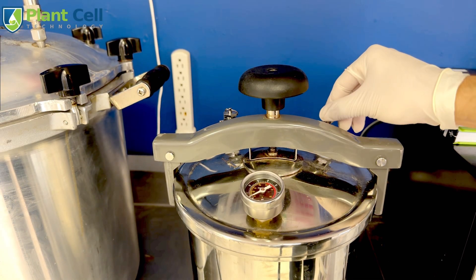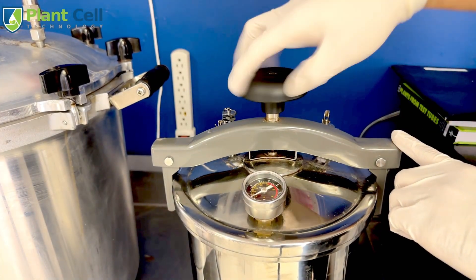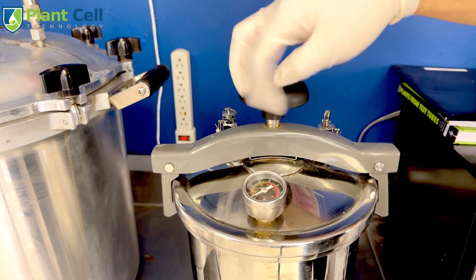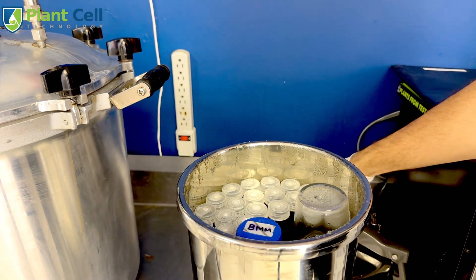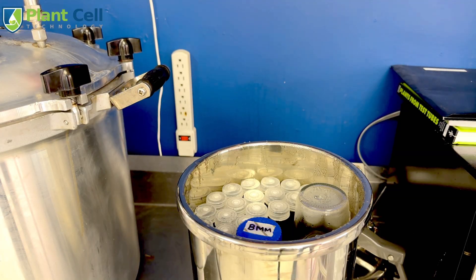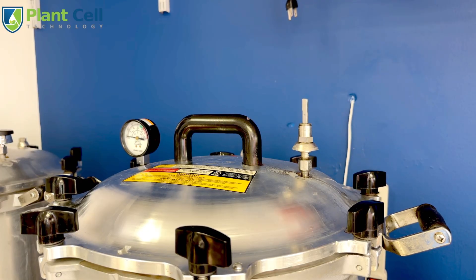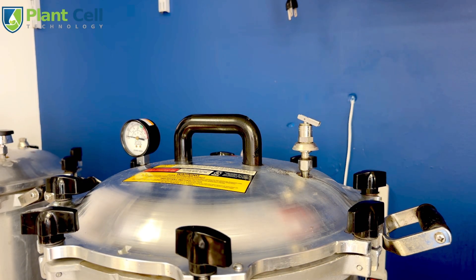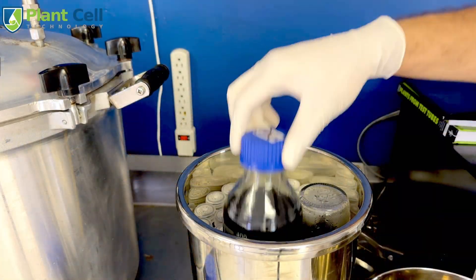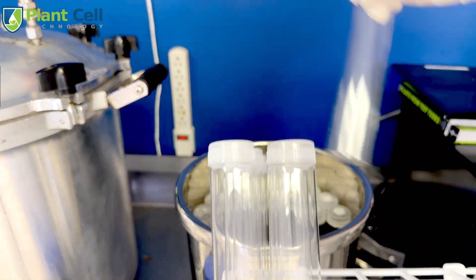Once steam is coming out, you can close the valve and let the Athena sterilizer do its cycle automatically. It will run a 25-minute cycle and turn off by itself. Let the pressure come down to zero before opening the sterilizers. After you open it, leave everything there for about five minutes to make sure everything has cooled down. At the same time, the All-American is just starting to bleed all the air, and now I'm closing its valve.